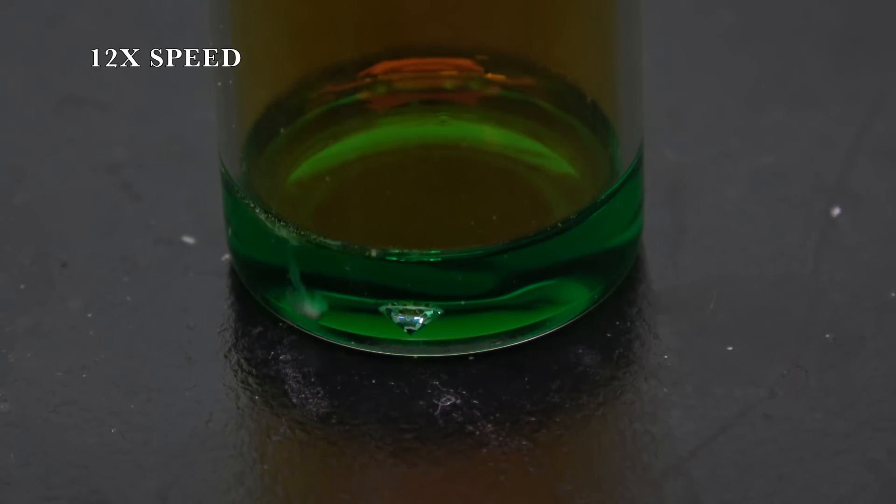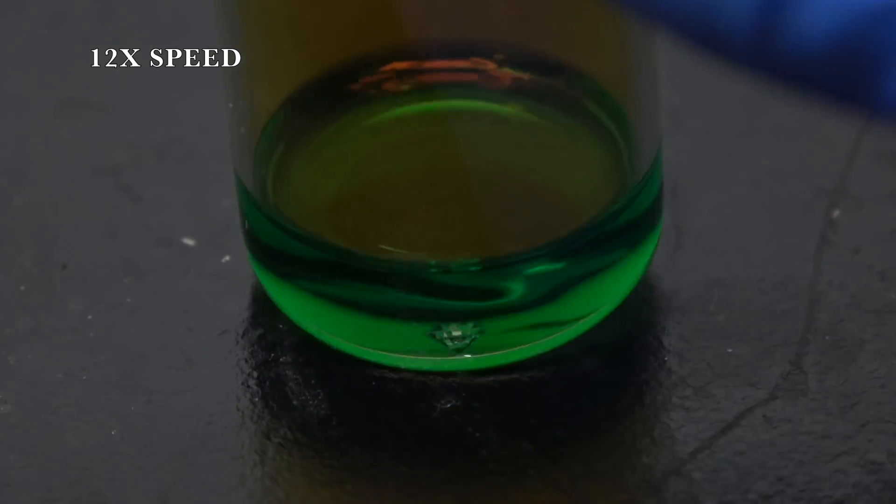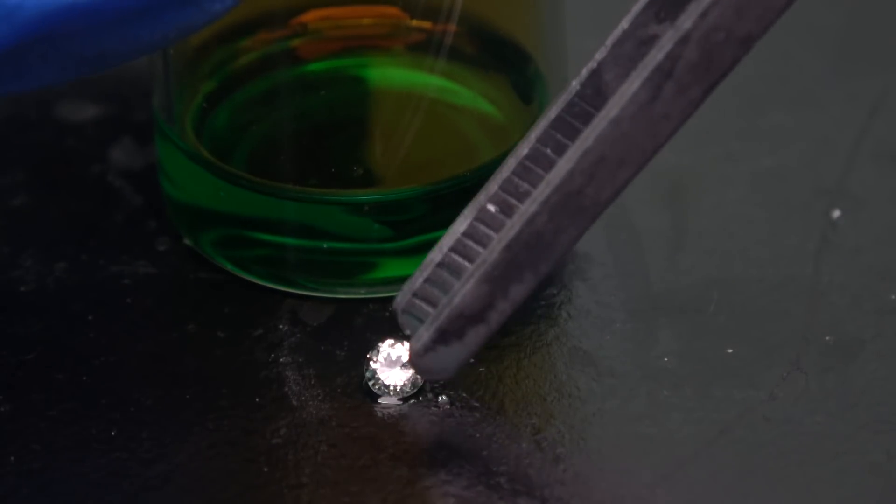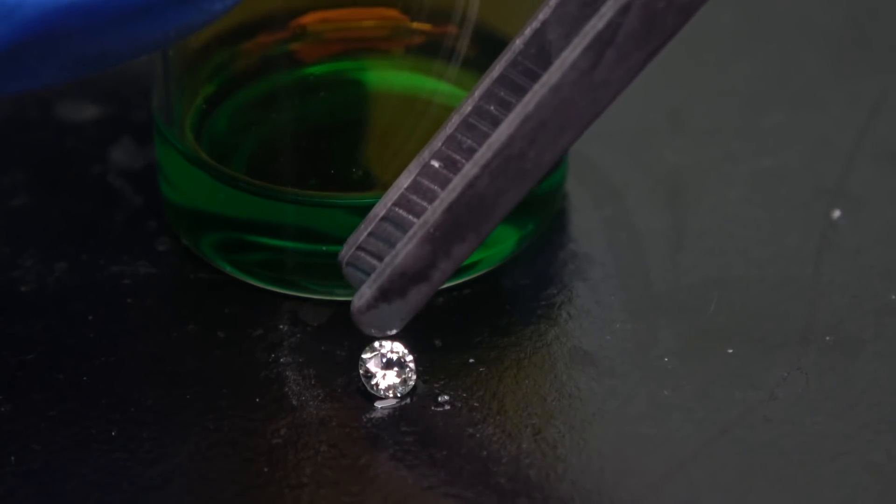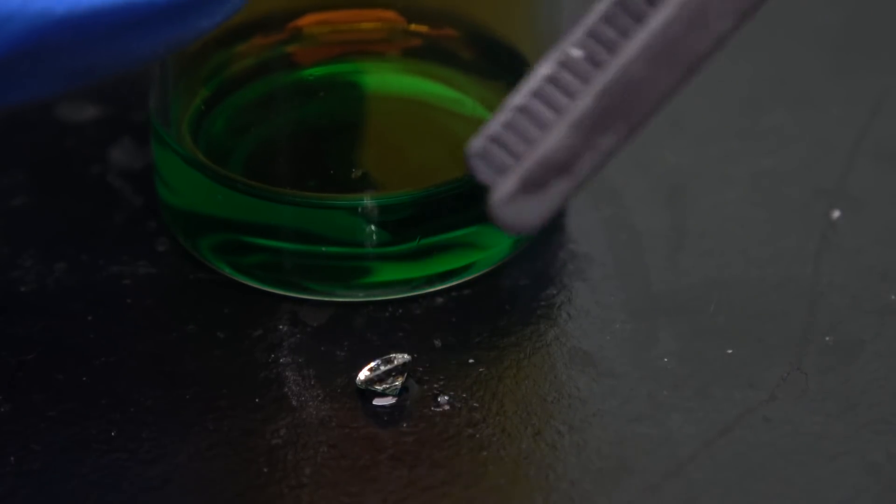After 4 minutes of intense reaction, the piece of copper was nowhere to be found. Okay, let's see how the diamond is holding up. It seems that the diamond is doing just fine.